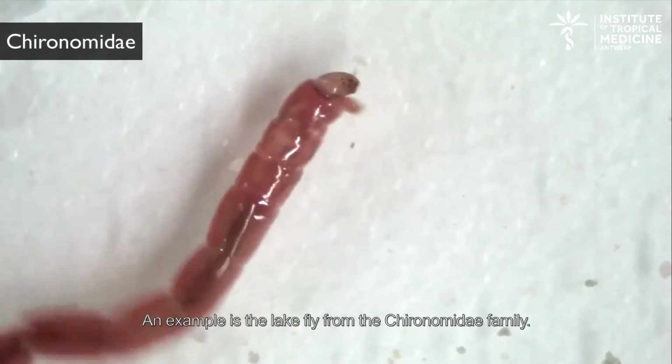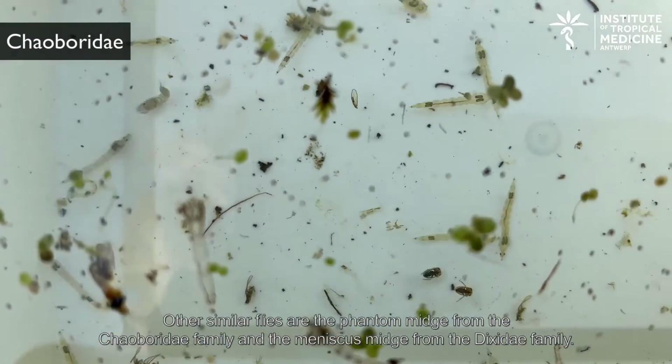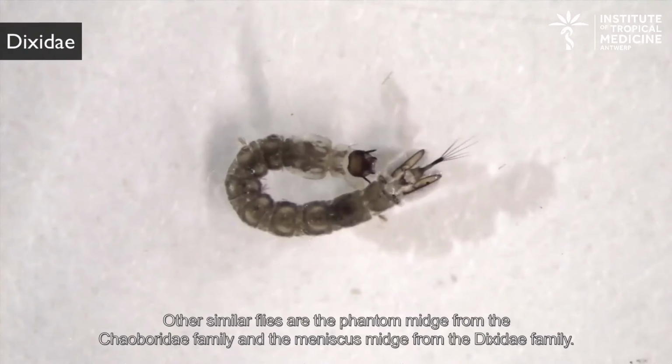An example is the lake fly from the Chironomidae family. Other similar flies are the phantom midge from the Chaoboridae family and the meniscus midge from the Dixidae family.